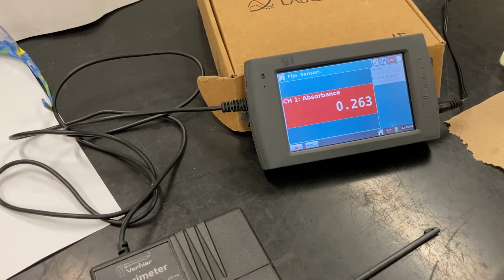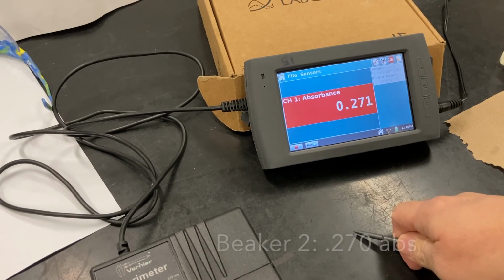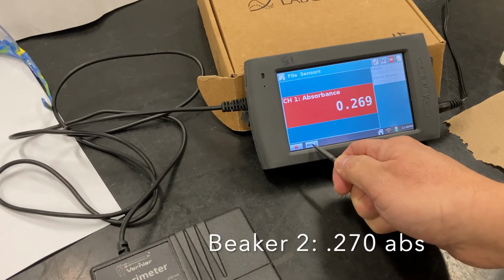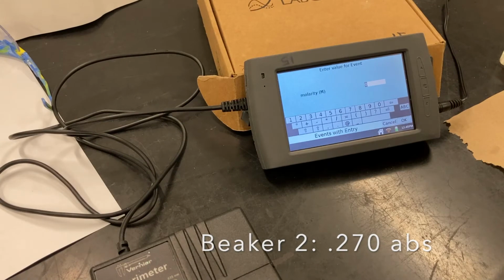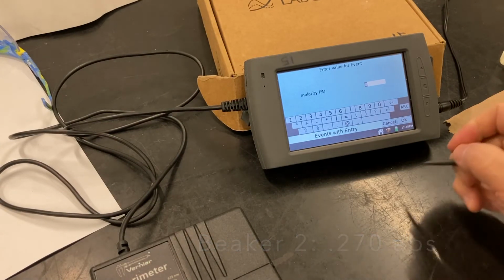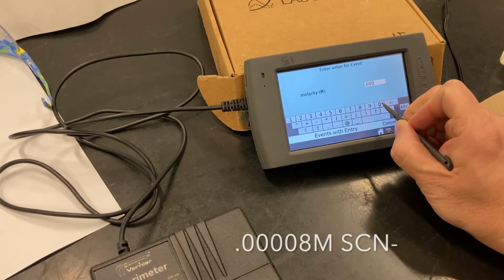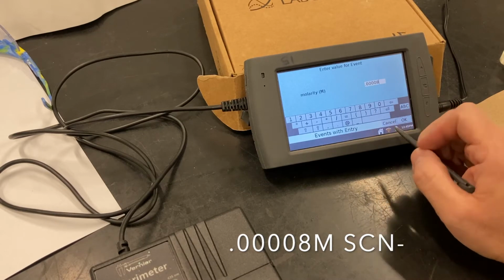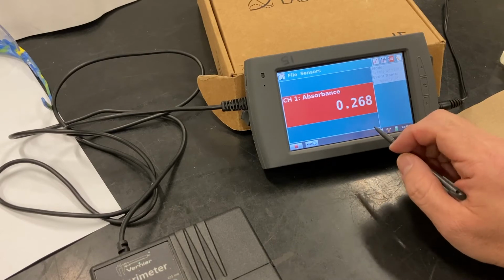All right, so absorbance for beaker 2 is 0.270. Okay, and the molarity for this, using the dilution formula, was 0.00008, or in other words, 8 times 10 to the negative fifth. And we are going to prep solution 3.